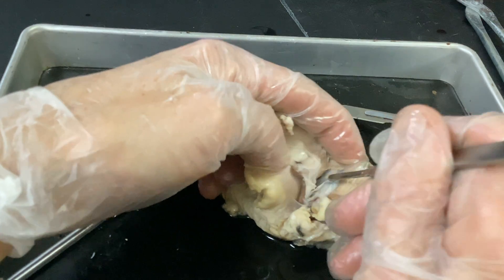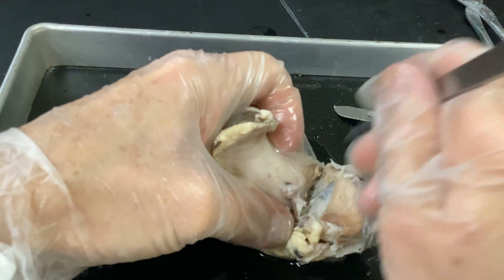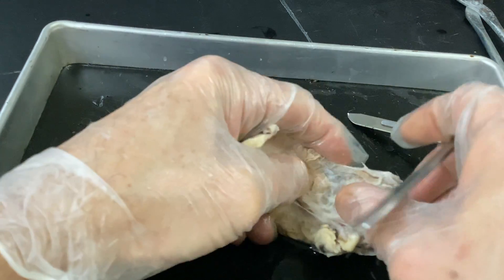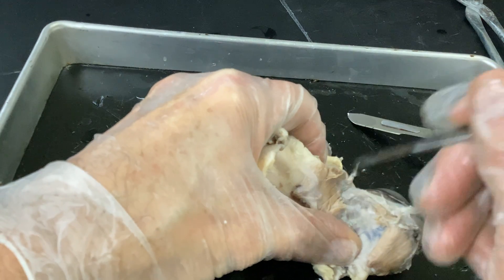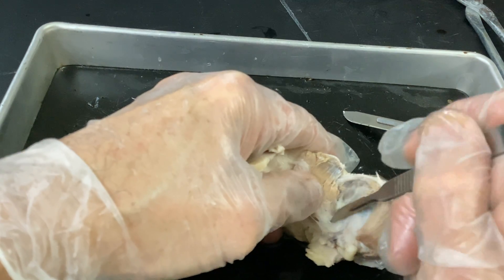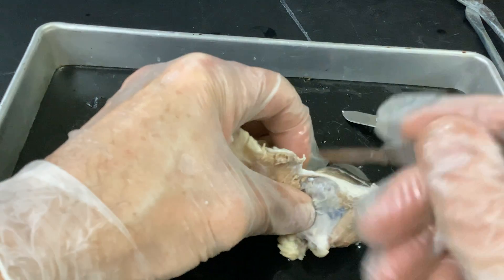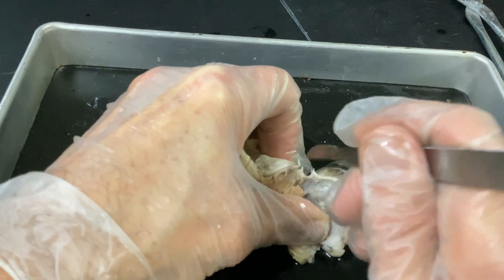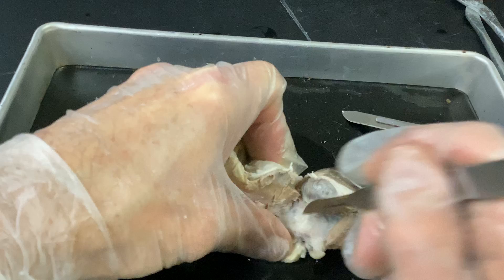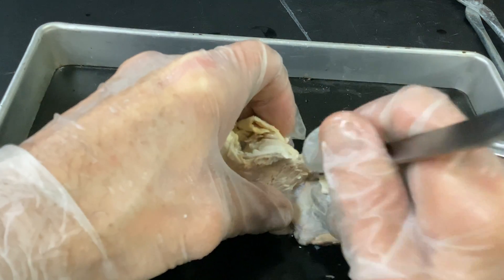I'm not going to be super careful — I want to get the majority of this off and then clean it up later. I'm just literally cutting away as much of that muscle as I can. We talked about origin and insertion — this muscle is literally inserting on that sclera, which is super durable. It's got some collagen fibers for durability.